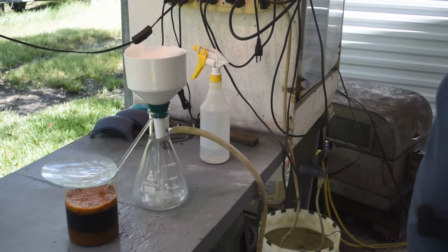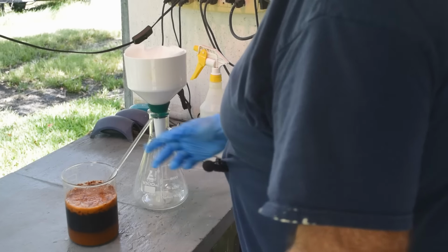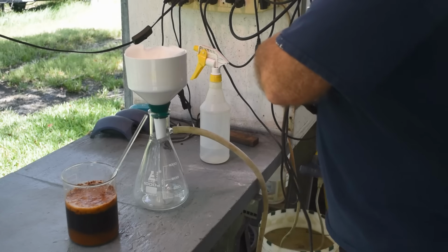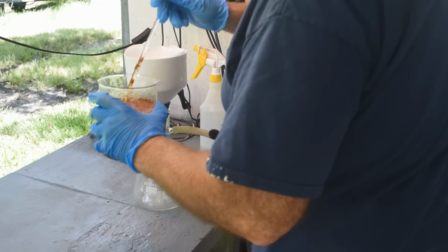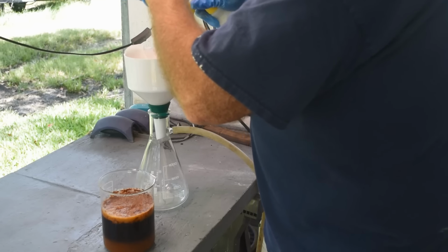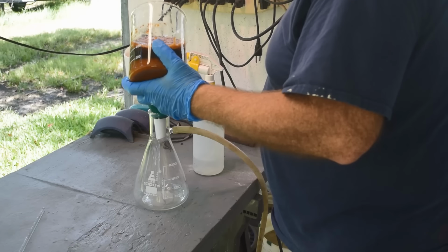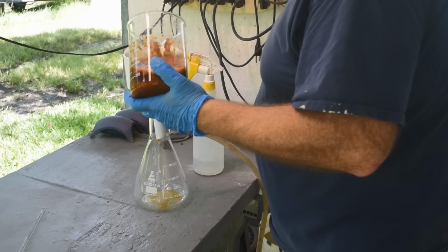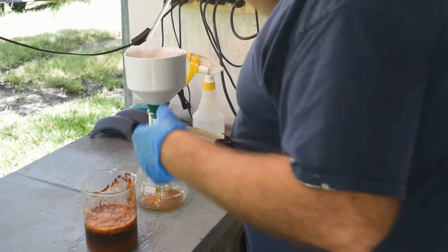Alrighty, let's get this blood red stuff filtered. Whatever the frothing was seems to have stopped. A lot of paper pulp here, and a lot of red liquid. So, let's see if we can get this filtered off my stir stick. Okay, it's coming through.